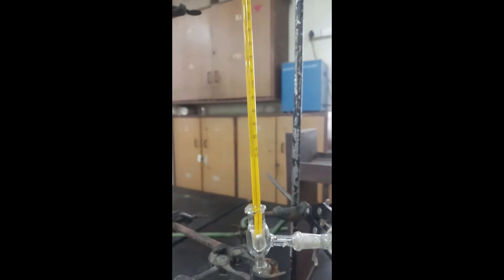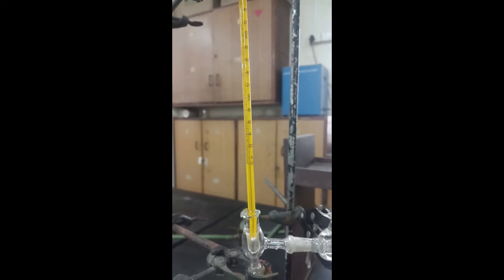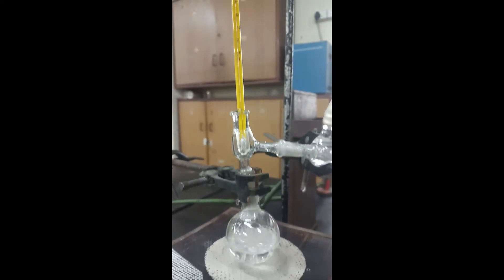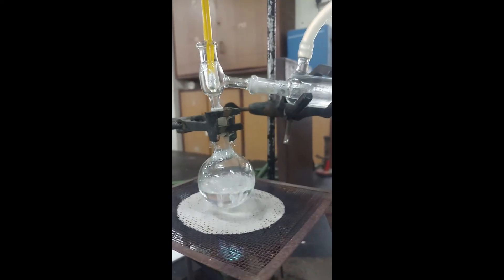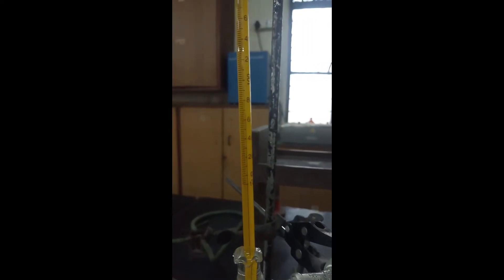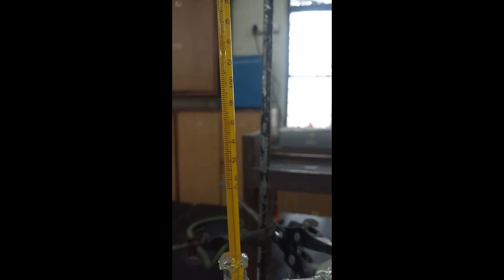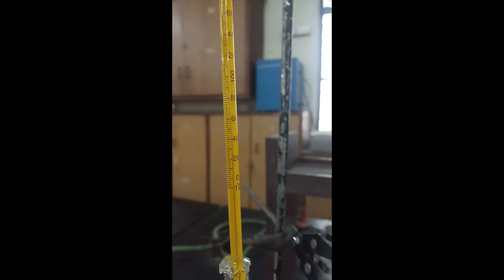Then the temperature will start increasing due to further heating. Here it is very clear that it has gone to 70 degrees Celsius.